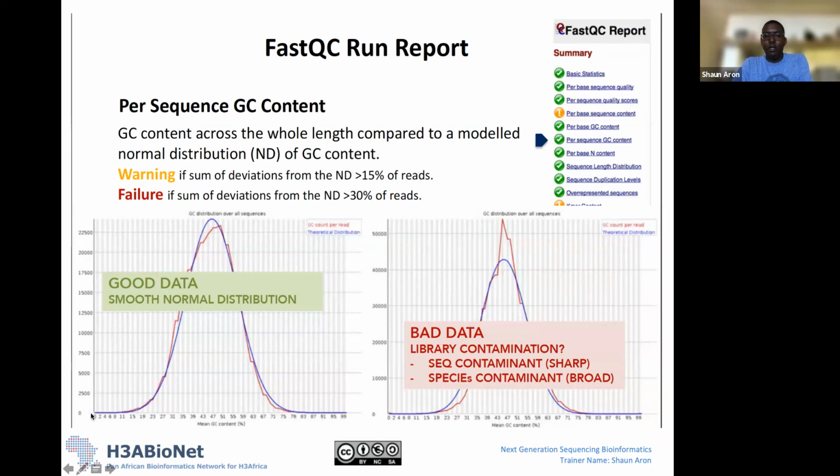So again, on the x-axis, you have the mean GC content. And this is across all your reads. And essentially what we're looking for here is a relatively smooth normal distribution. So we're looking for a distribution that is similar to the normal distribution.